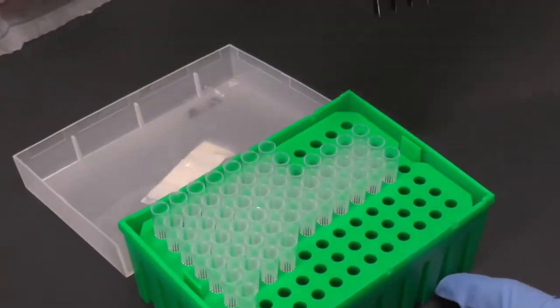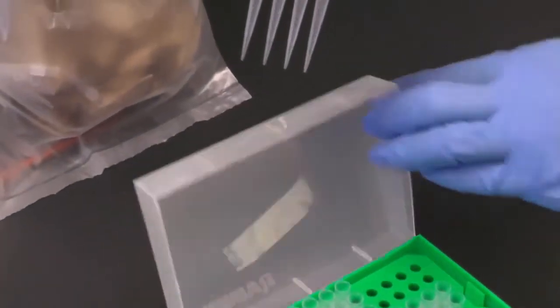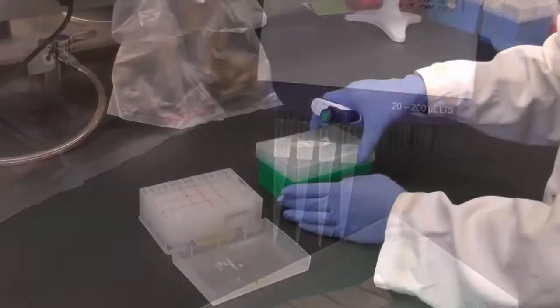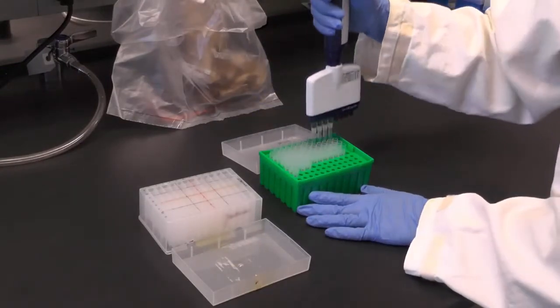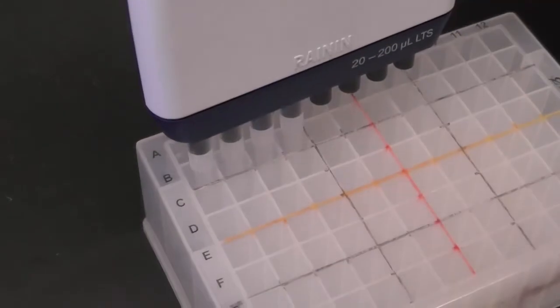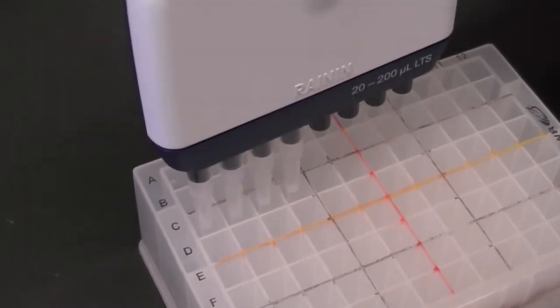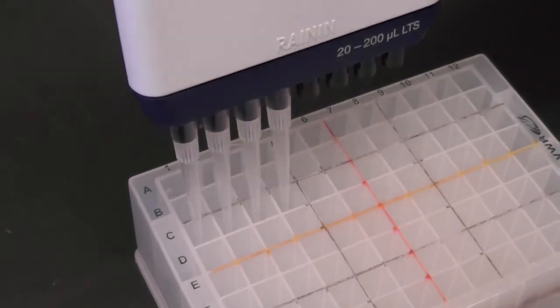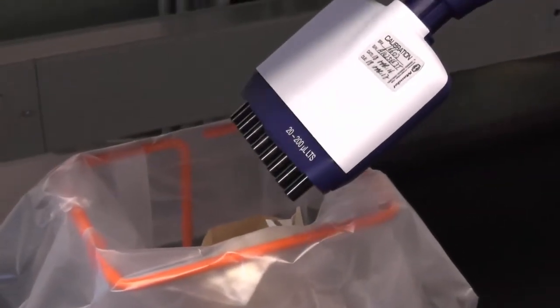Make sure you only attach the number of pipette tips to your pipette that matches the number of samples used each time. Change the pipette tips before you proceed to mixing the second dilution. Repeat the previous step several times to make as many dilutions as you need. Always remember to change tips between dilutions to avoid carrying over any extra volume.